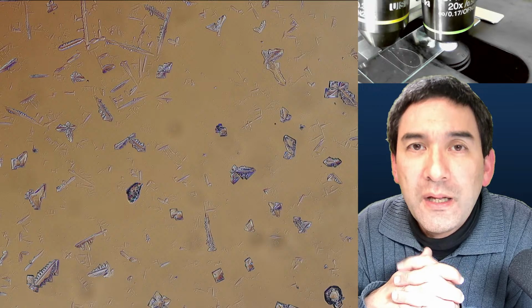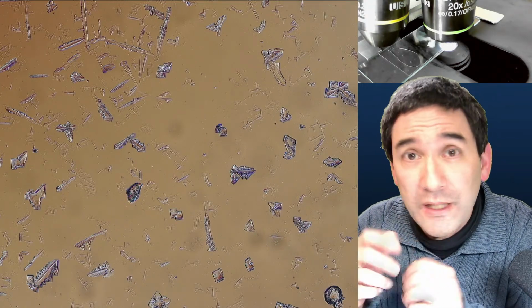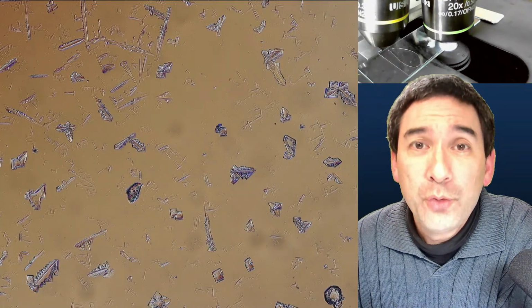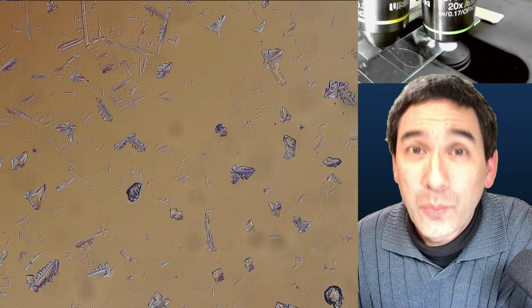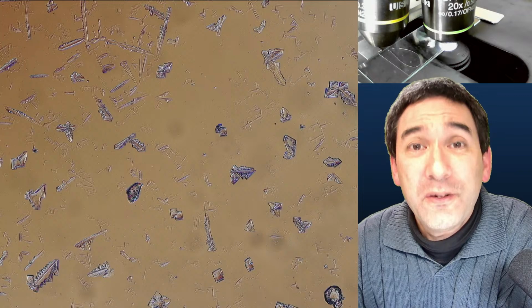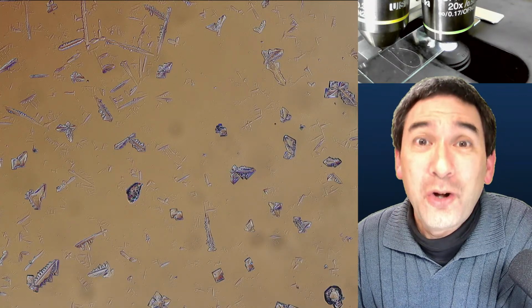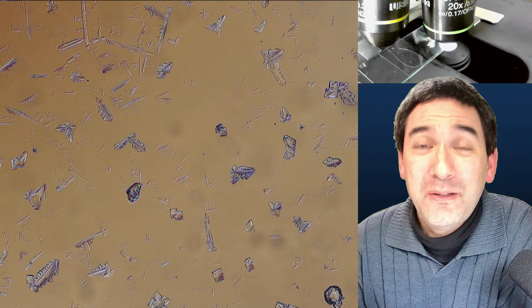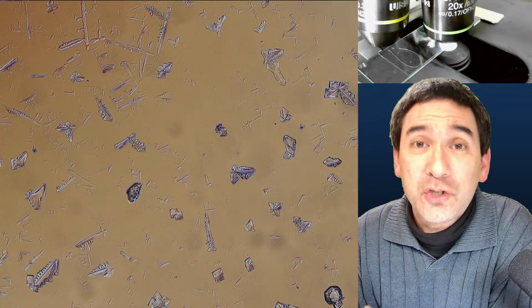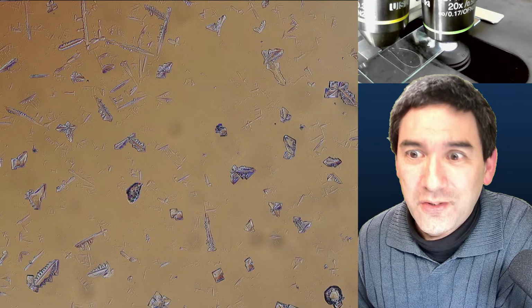I'll be honest with you. Many of those microscopes, like from AMScope, Swift, whatever, all use objectives that are basically made somewhere in China. If you go to AliExpress, for example, you're most likely going to find very similar, if not the same objectives. So chances are pretty good that if they look the same, they are also the same, because there are not so many manufacturers of objectives around that actually make those.